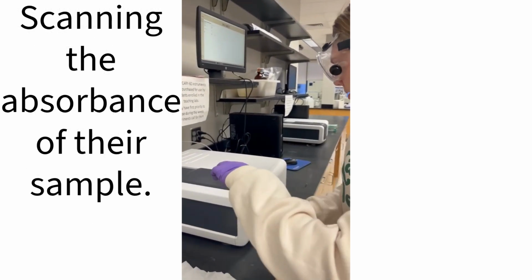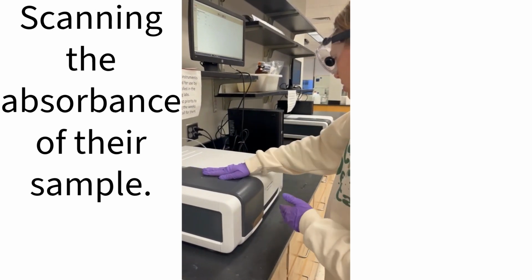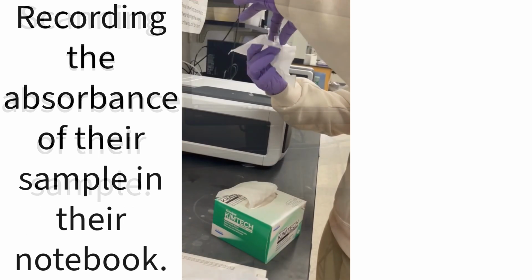Then I'm going to place it in the spectrophotometer, closing it. Over here, I'm gonna hit read. Okay, and we get 1.035.